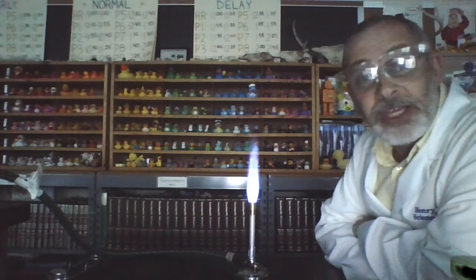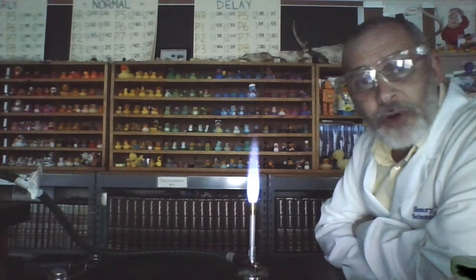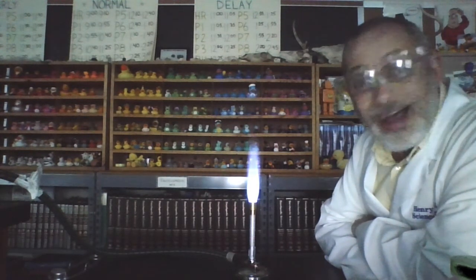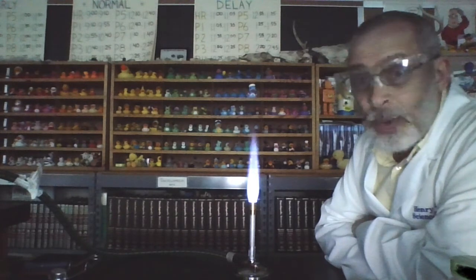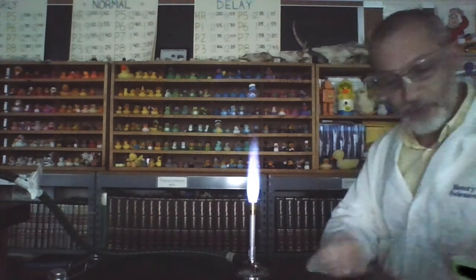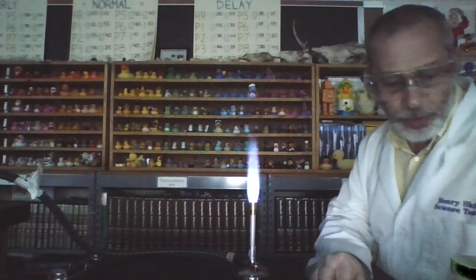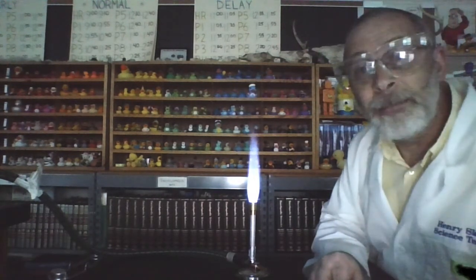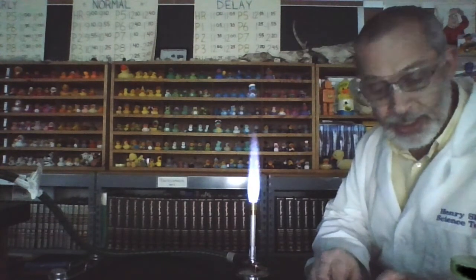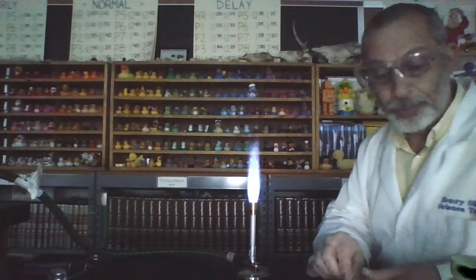So let's begin here. Presumably you have already read the problem, written your hypothesis, and now we're ready to make our observations. So our first observation will be of barium chloride. You should be noting these observations in your book in the appropriate location.